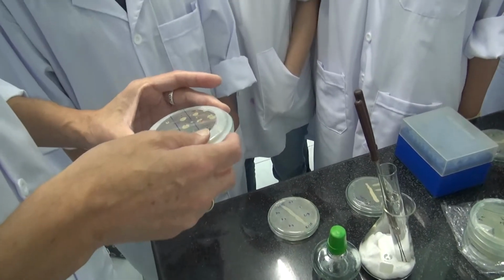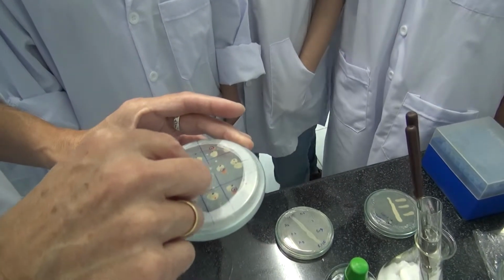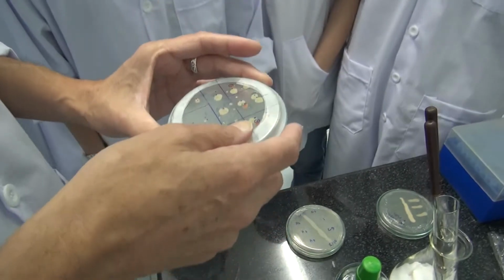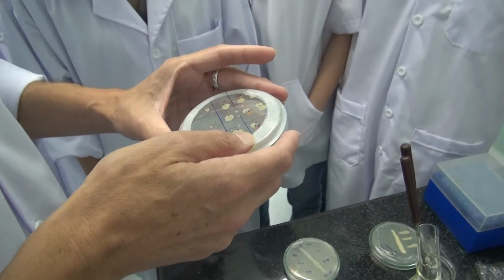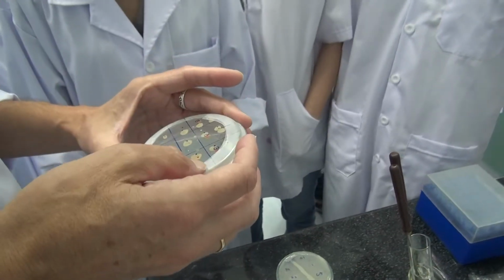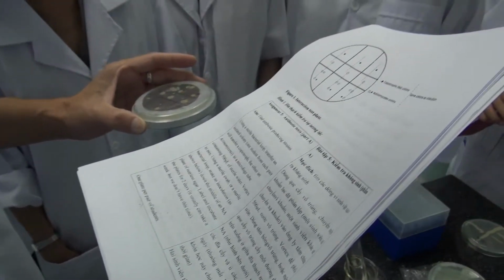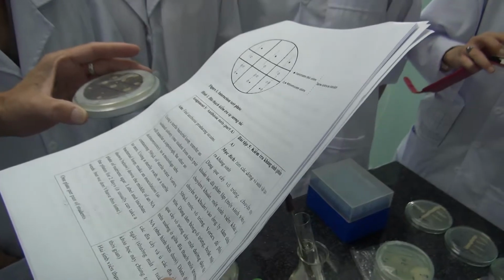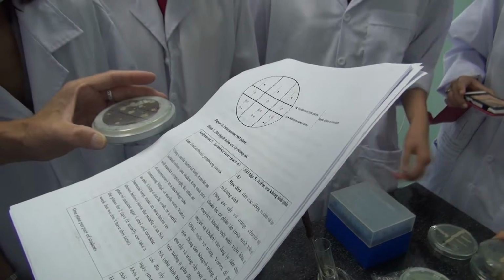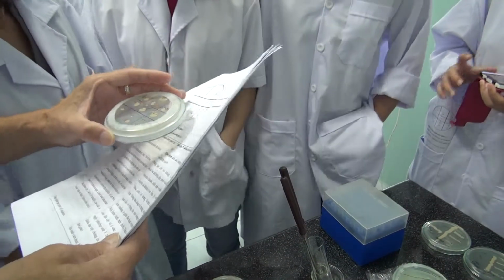Now when you have one like this, I don't remember what we had, but these are probably the controls. So I have to see the chart. Thank you. The printing doesn't print the gray circles, so you have to imagine that. So copiotrophs. Do you remember? I can explain. Yes.